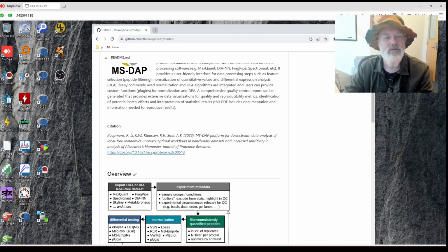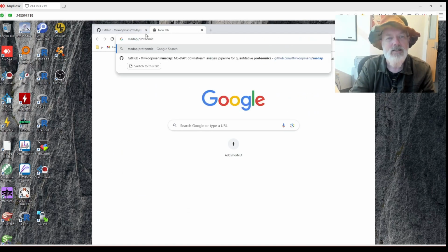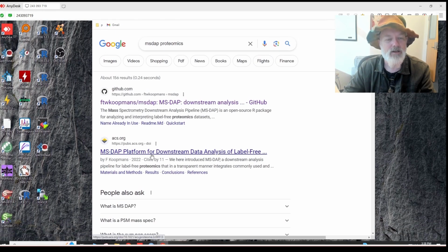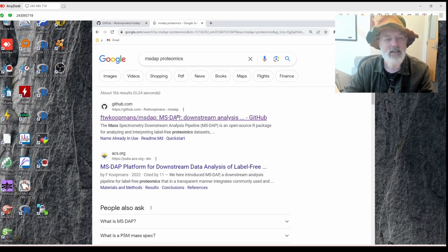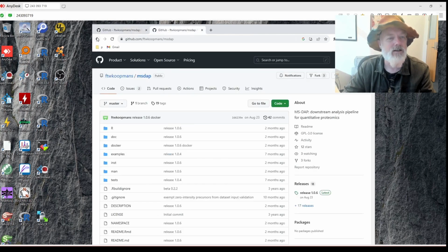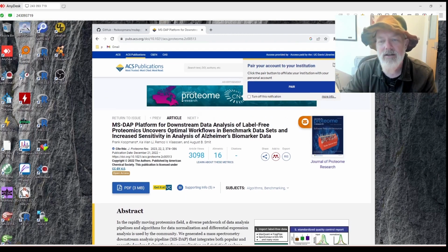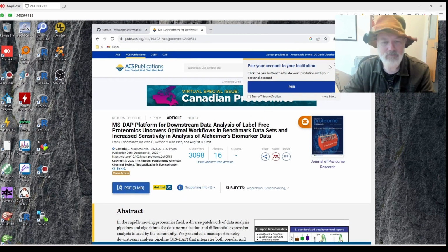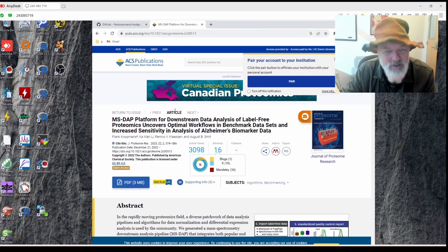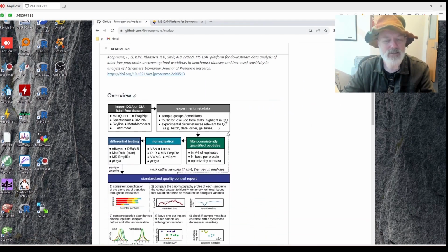So the first thing I do is I Google search MSDAP proteomics, if I can spell it right. And that should show up both the publication and the GitHub site. Usually I go to the GitHub site, which is right here. But on this tab, let's look at the publication. So here's the publication, Journal of Proteome Research, came out in December 2022, so almost a year old at this point. Okay, so let's give it a shot.